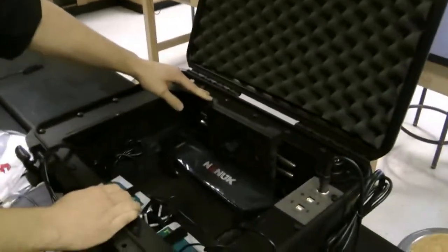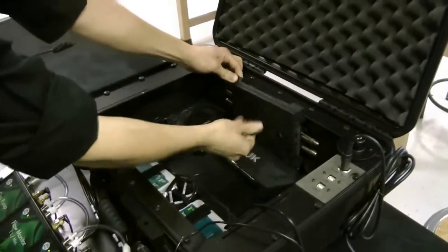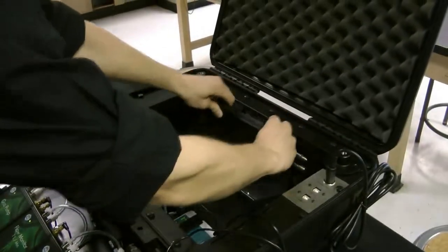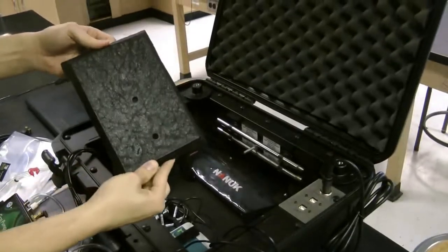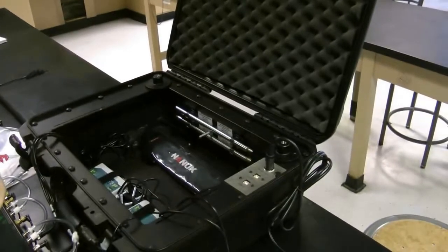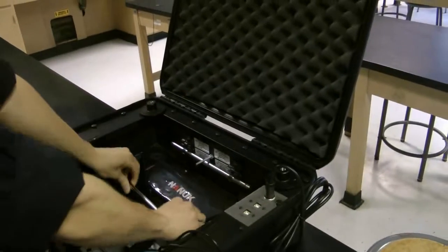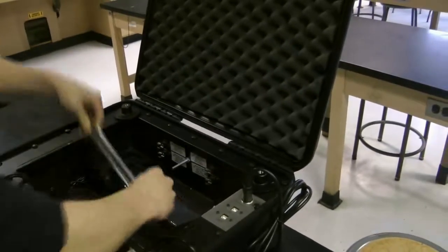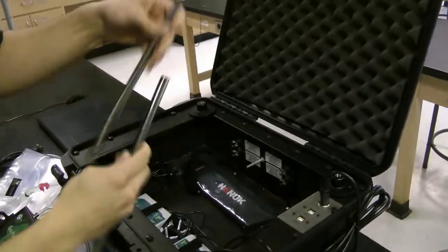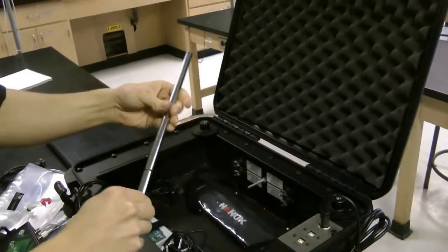Inside the QBox, you can see that there is a stand at the back. Simply disconnect this and place it aside. This is the base for your stand for the leaf chamber. We'll set it aside for now. Now, there are 2 pieces to the stand, and they connect with each other through the top. So we place one on top of the other and screw them together.